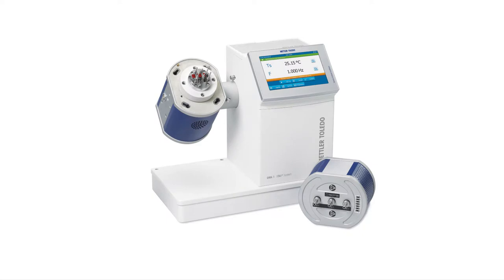In order to achieve accurate results, a DMA has to be regularly calibrated and, if necessary, adjusted.